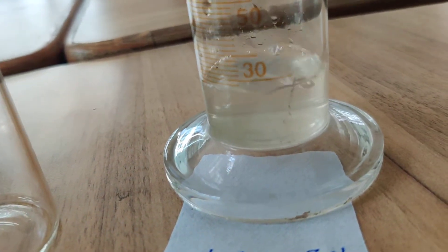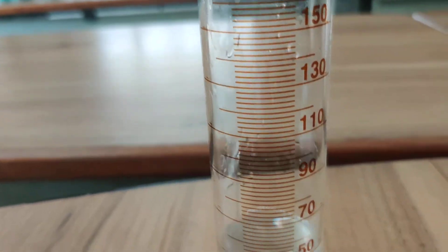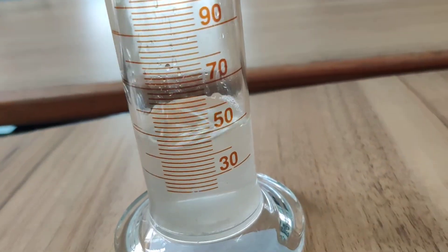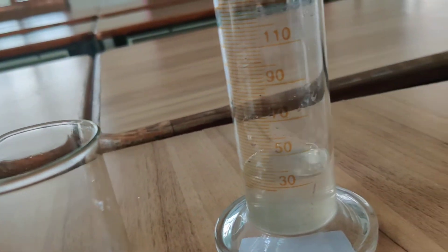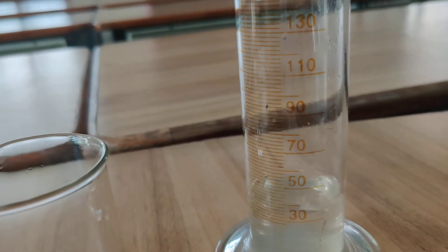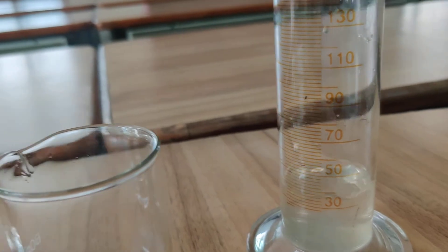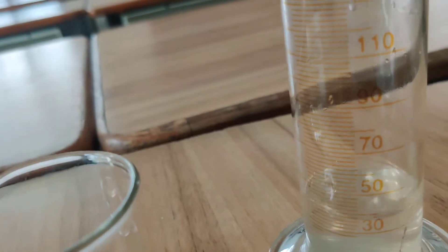With the help of the measuring cylinder we will measure the volume of water collected. Then after three minutes again we will take the second reading, then the third reading after three minutes. In this way we continuously take readings up to twenty minutes, with each reading taken after every three minutes.